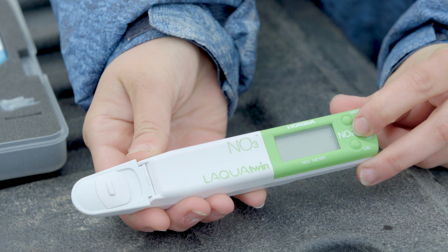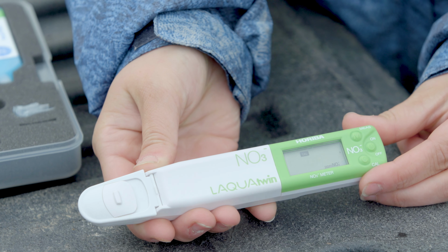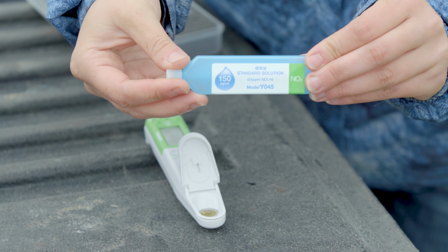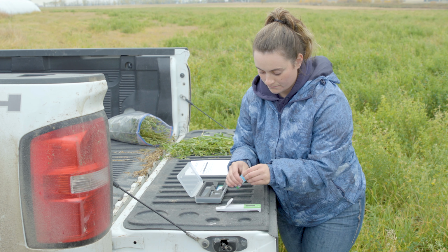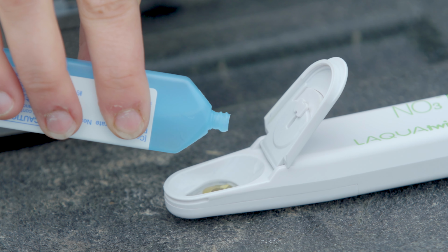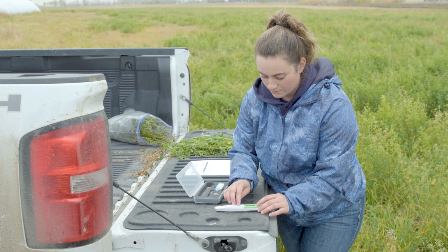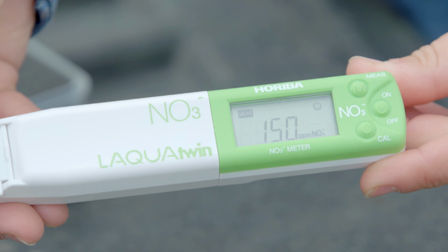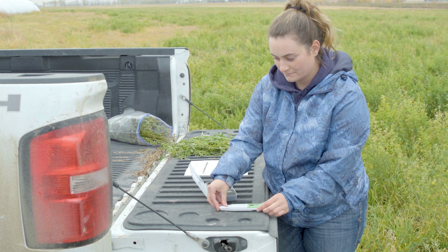You can start by turning on the unit and then pressing the Cal button. And it should flash 150, indicating that you should apply the 150 standard solution. So you can open the unit and apply 2 to 3 drops of the solution to the sensor. Then close the cap, press Cal again, and when it's finished, it should show a smiley face. So once your smiley face has shown, you can then rinse the unit with some water and then proceed to the second point of calibration.